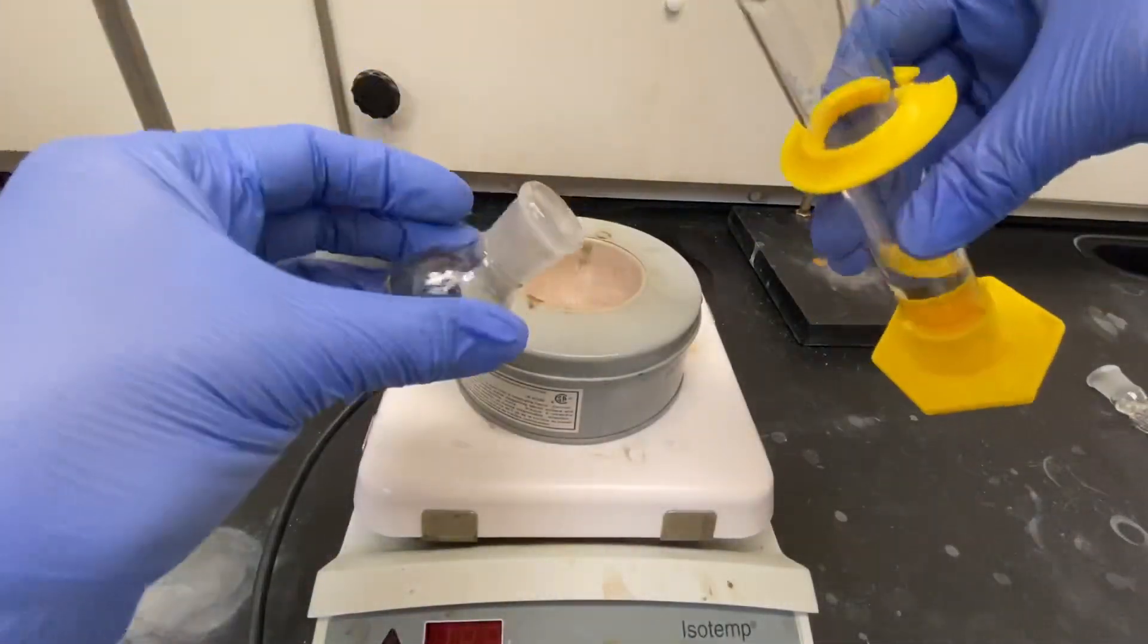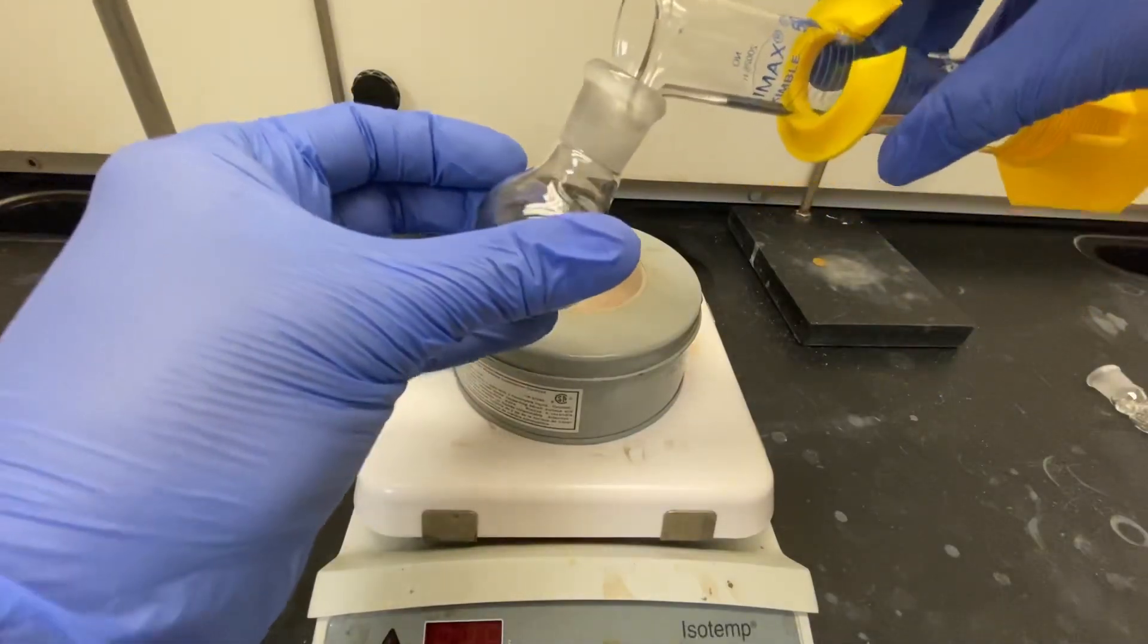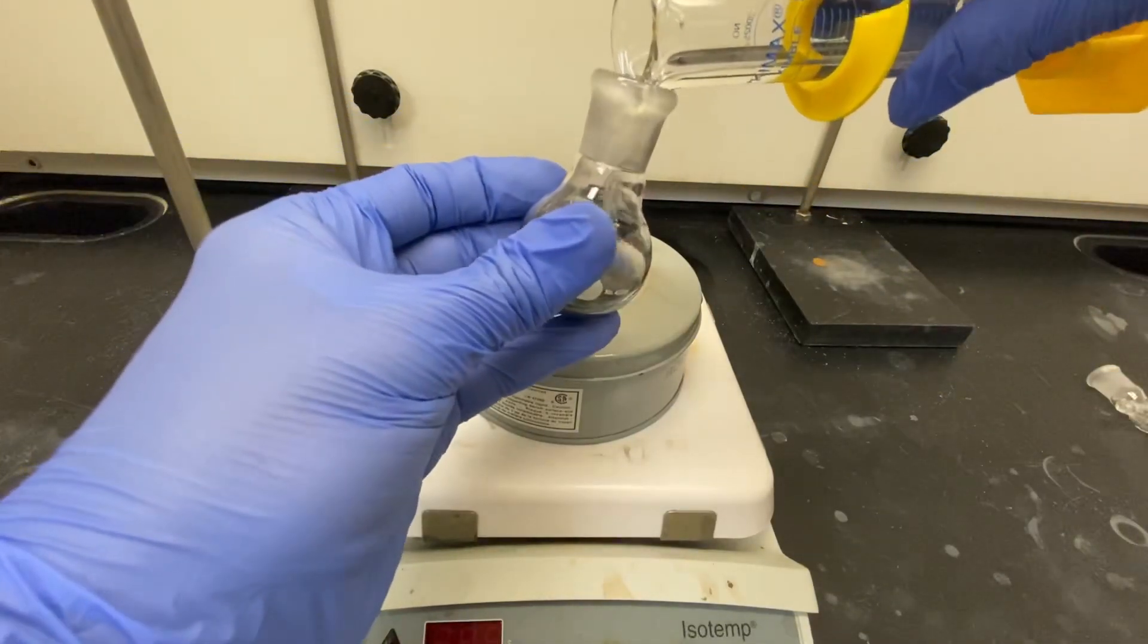To the mixture add 18 milliliters of anhydrous methanol and again swirl to mix.